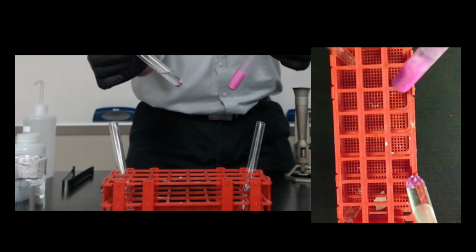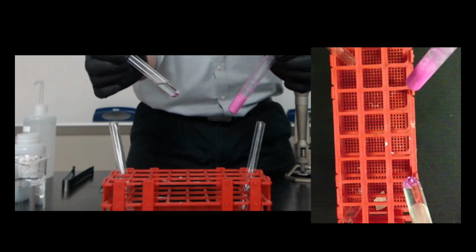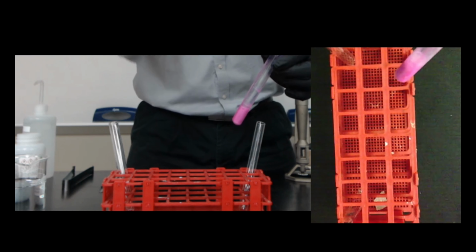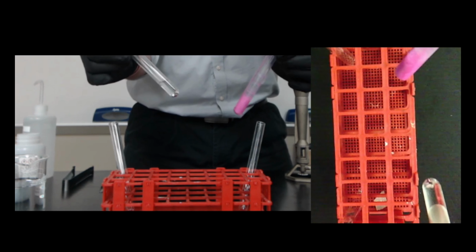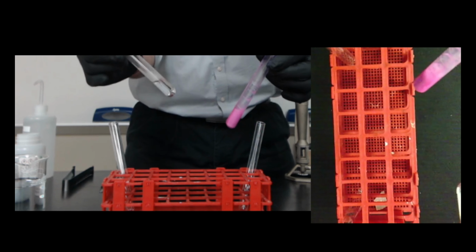You can see the bubbles. You might even be able to hear the bubbles being produced with the calcium. You might not be able to see or hear the bubbles with the magnesium. There are bubbles, just not very many. It is reacting just very slowly. So calcium is definitely more reactive than magnesium is.